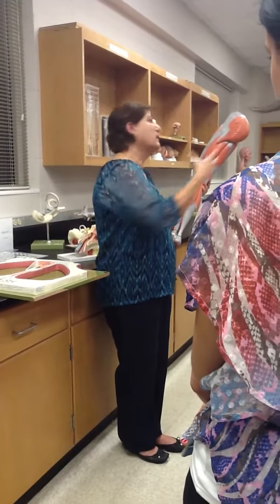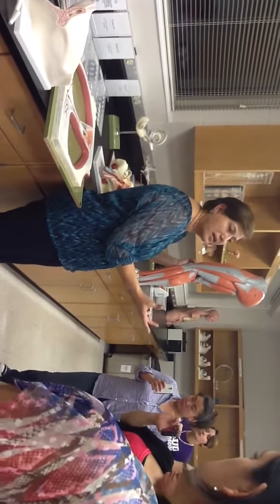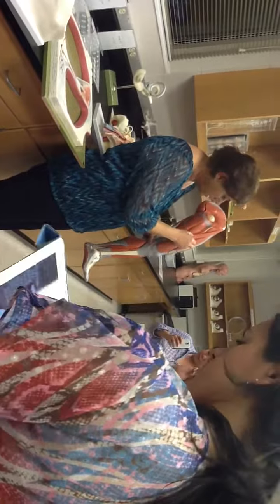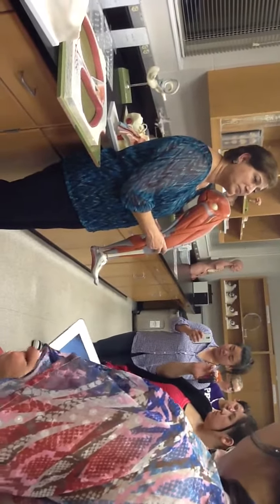To look at, like, you know, cat separately and human, there's a little bit of a difference. Here, gastrocnemius, soleus right under it, Achilles tendon, exactly like the cat. Here, tibialis anterior, just like the cat, right next to the tibia. Like I said, these two are different in the human, but other than that, the way these muscles are sitting, on the anterior aspect or on the medial aspect beside the gracilis and sartorius are exactly the same. But the cat muscles are the closest to the human.